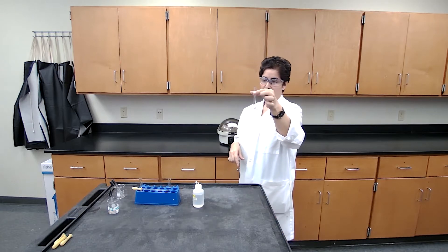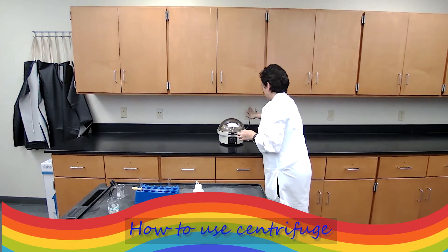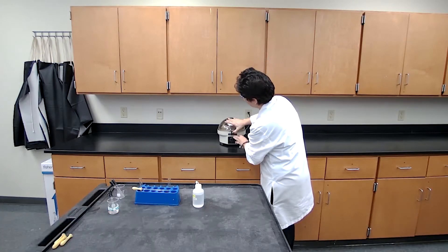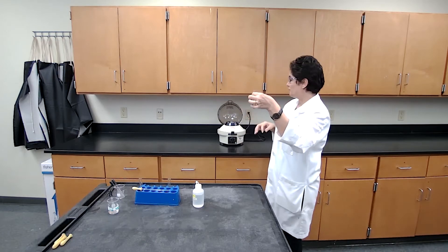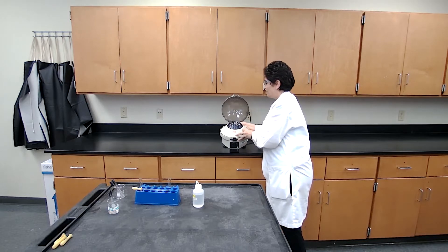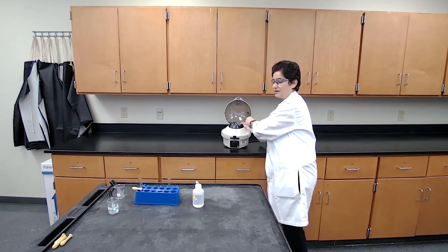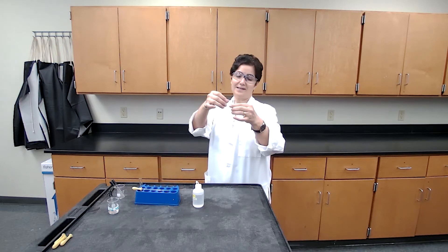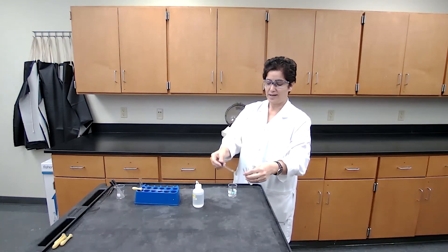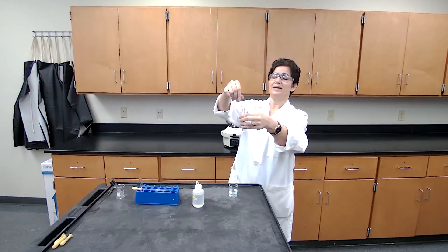On the next step, I need to use the centrifuge. First, we plug in the centrifuge to make sure it has power. We open the centrifuge lid and place a test tube with a counterpart on the opposite side. So if I'm using slot number four, I also place another test tube with water on the opposite side — not necessarily the same volume, but the same mass.